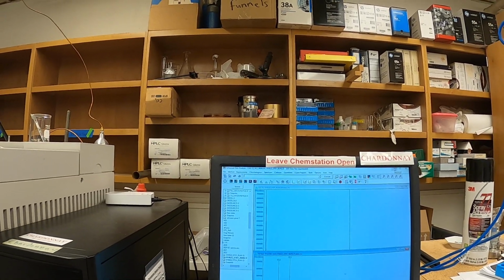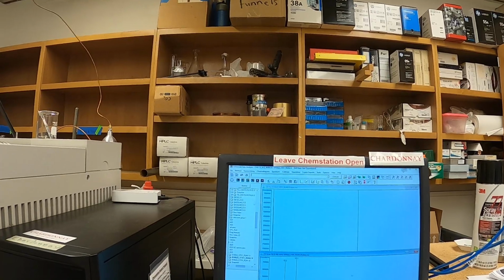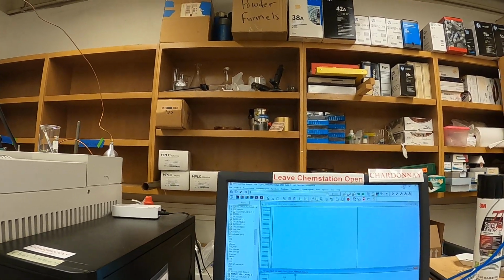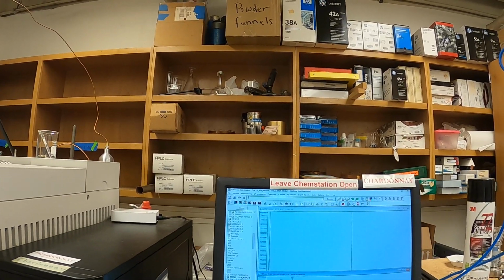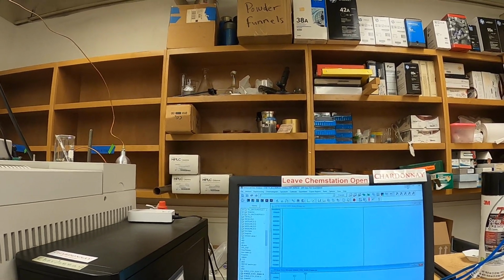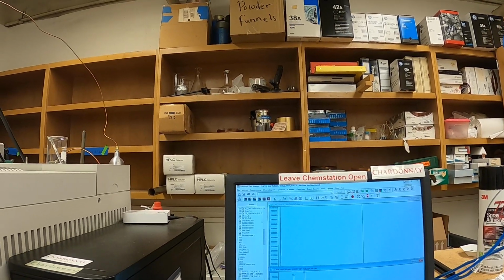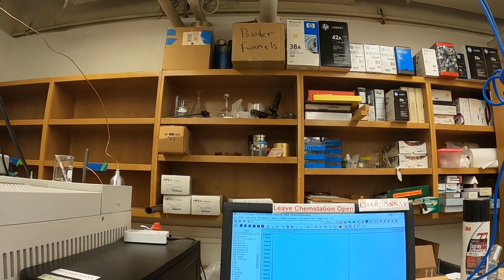Do you see the proper fragments? And of course, you know, 85 and above is very believable. You can't just run off with any hit. Sometimes I change the library back to 2005 and bromobenzene comes up as dibromopentane. You'd be amazed how many students are fooled by that library hit.